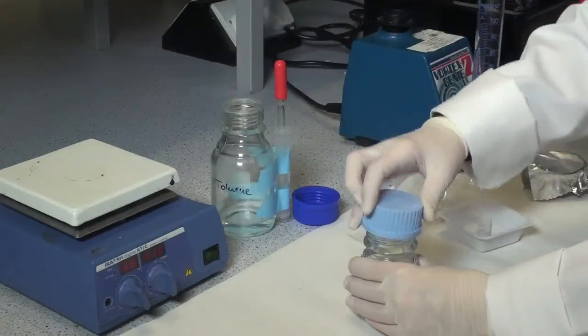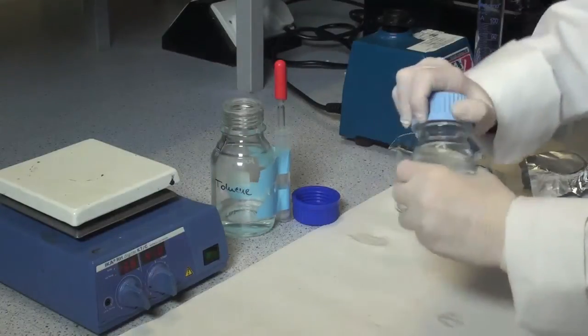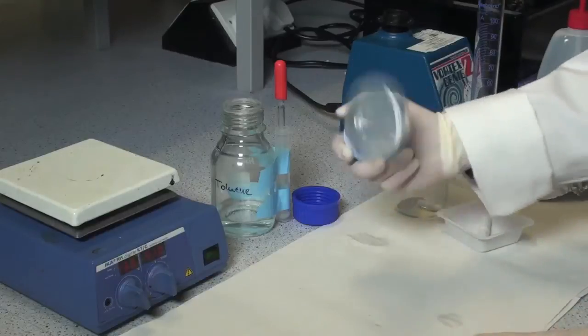Seal the container and store this solution either at 4 degrees Celsius or room temperature.